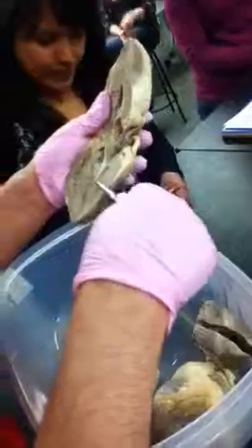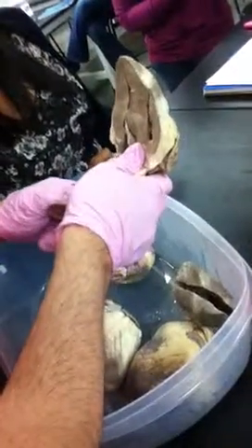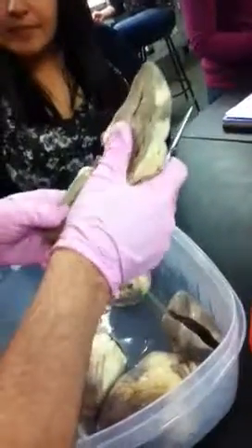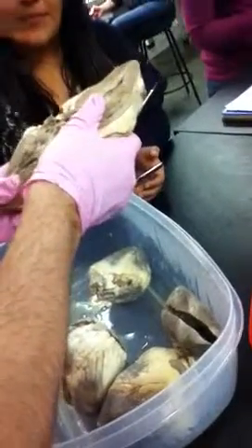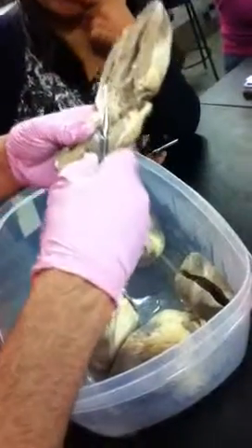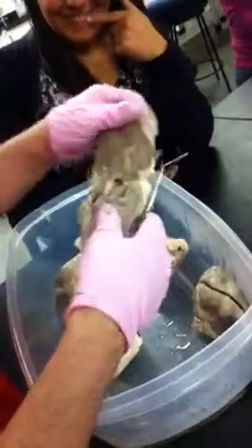So papillary muscles we didn't really see. They would be these little muscles down here at the bottom. What the chordae tendineae is attaching to would be a papillary muscle. Would that be more like a picture? I wouldn't worry about it. It would be more like a picture, or you're not going to see it. One of the two.